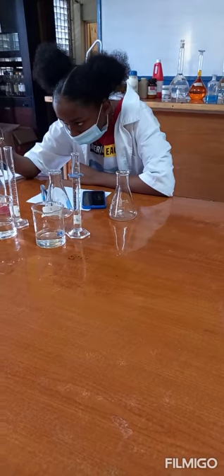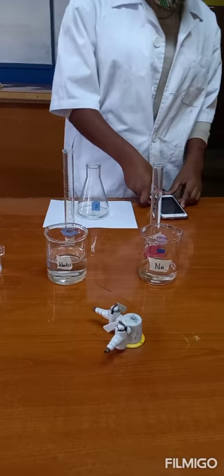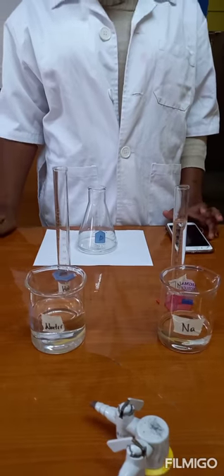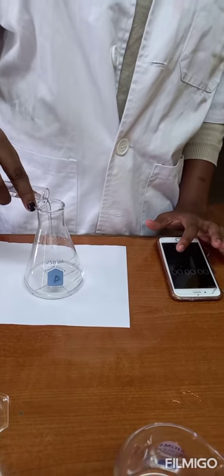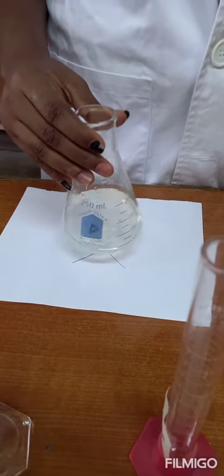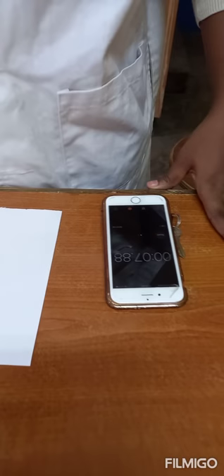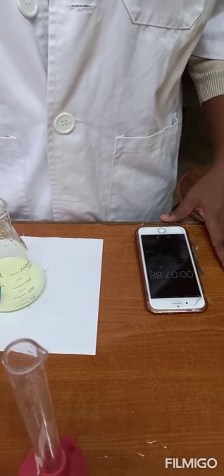We're doing two trials. There is one experiment here and she's going to do the same thing again — 25 ml of sodium thiosulfate to 25 cm³ of the hydrochloric acid. Start the timer, mix. Stop the timer — it took seven seconds. It is important that the experimenter's individual reaction time is quick.